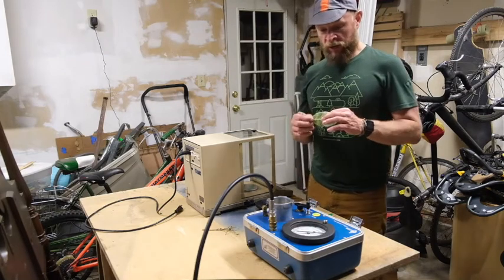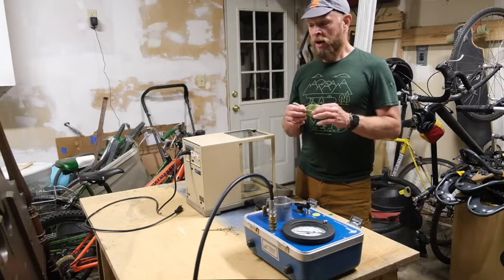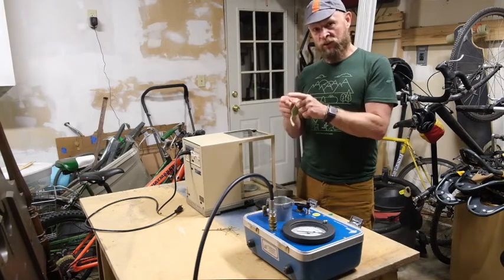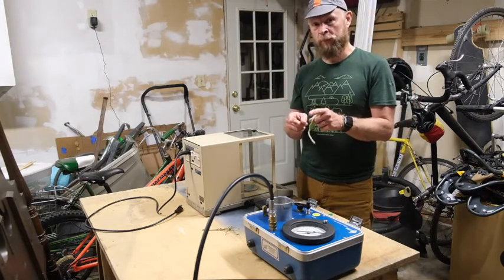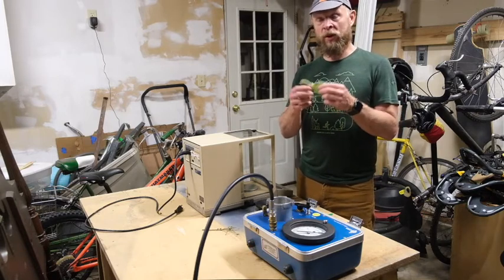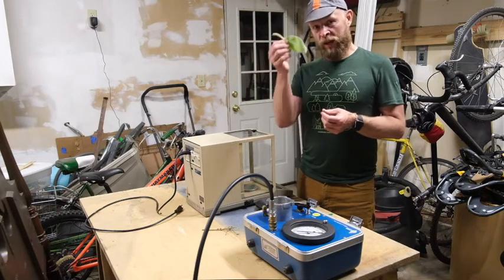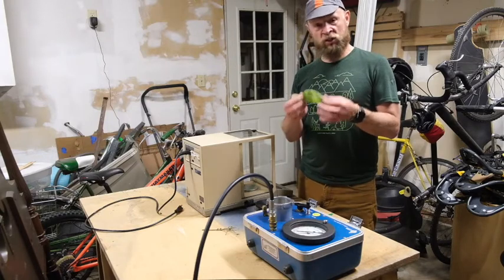So in order to generate a pressure volume curve, we need 2 variables, and you'll see this better in just a minute. We're going to take the relative water content of a leaf and the water potential, and we're going to pair those measurements. So we want those 2 things happening at the same time. And then because we're trying to identify the turgor loss point, the point when there's so little water in the cells that it loses turgor, we need to measure this leaf repeatedly from when it's well hydrated to when it's dehydrated. So we're going to do that by just drying it on a bench.